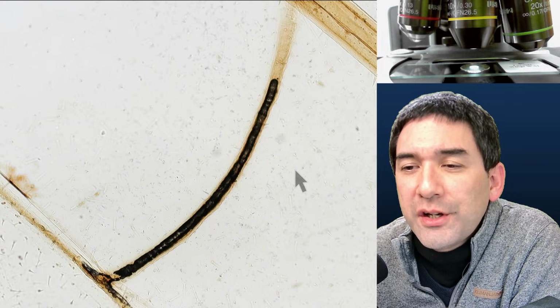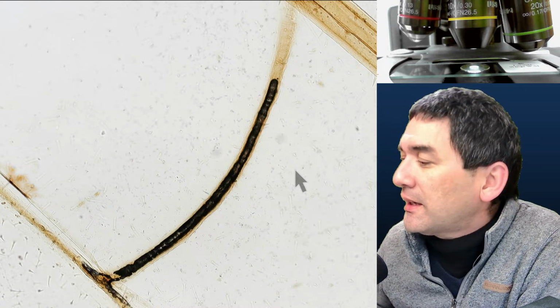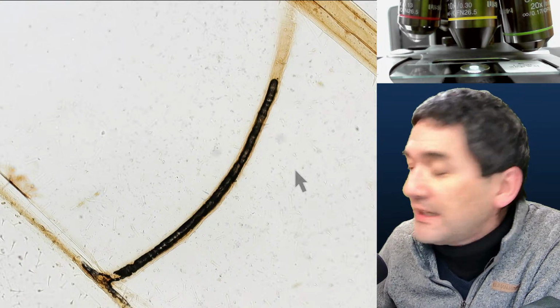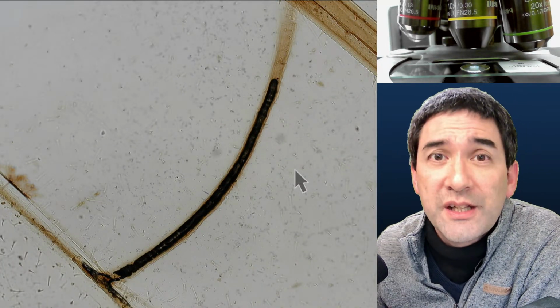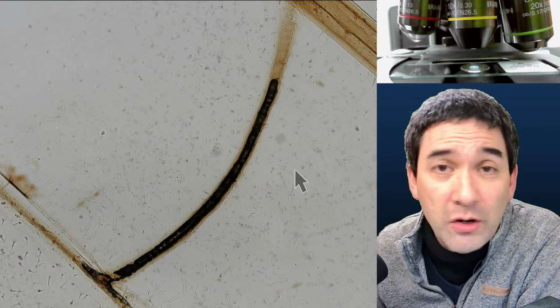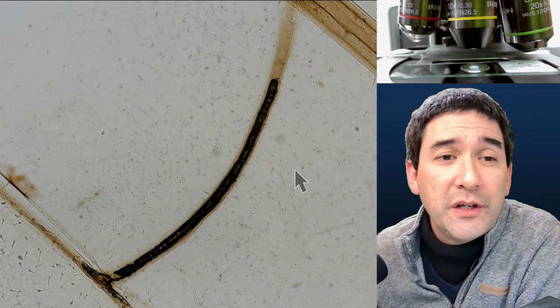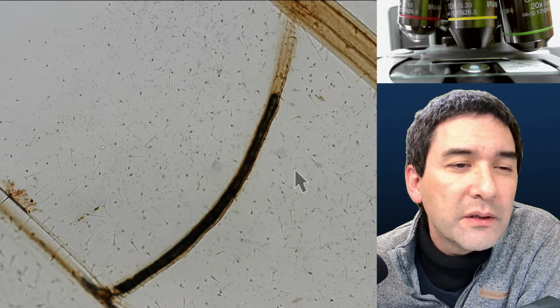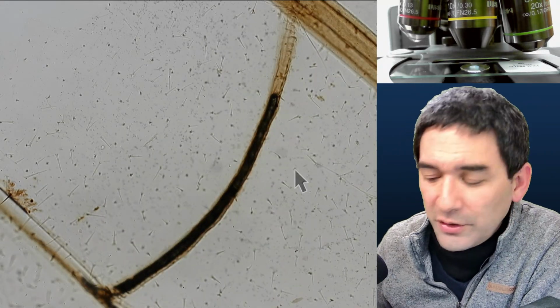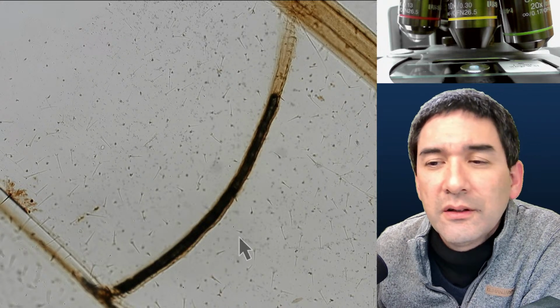Those little thorns here, what are those little protrusions on the vessels? Again, that's something you find very often in insects and arthropods in general: little protrusions, hairs, little scales and so on. Also over here on the wing of the locust, if you look very carefully, you can see those tiny little hairs on the wing surface itself.